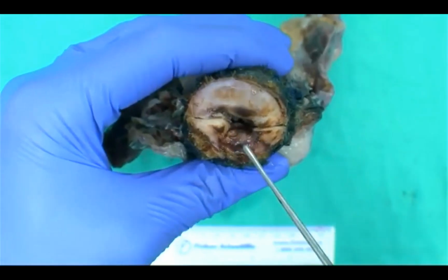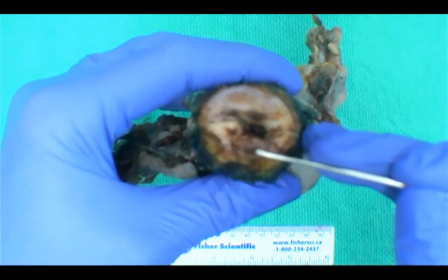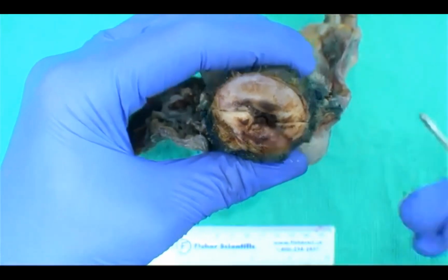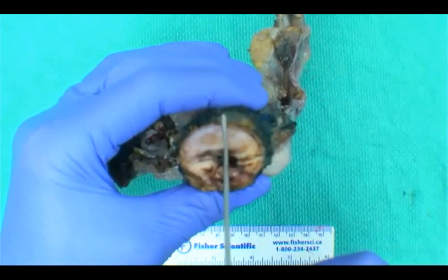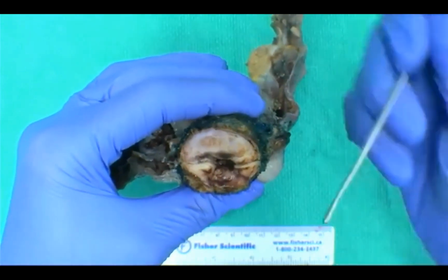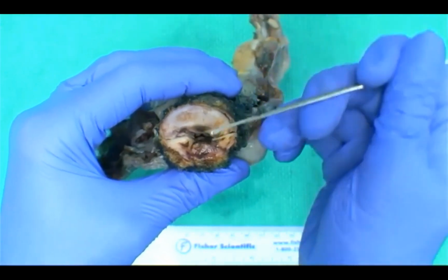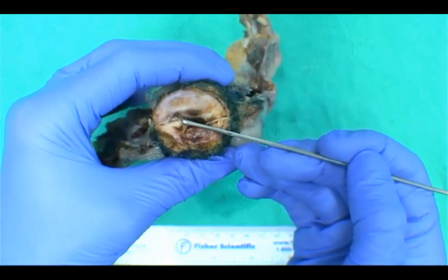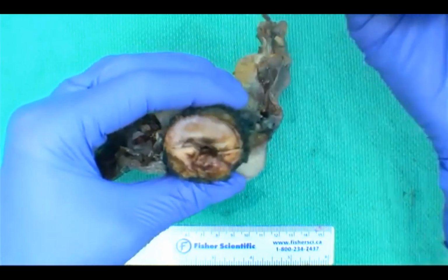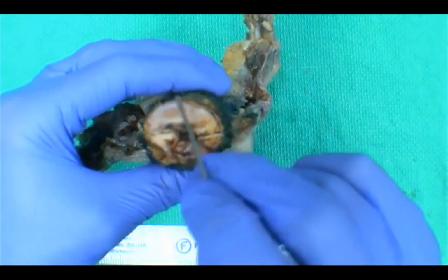and do a clock face. We would describe this kind of ragged and congested area as our lesion, and then you would want to give measurements to your vaginal cuff margin, which is right here. For us, we will designate the most anterior point as 12 o'clock and then radially section each quadrant. By radially section, we mean that we wedge the cervix. We'll section the cervix like so. And we usually end up submitting clockwise, and we'll designate 4 quadrants. So we'll submit from 12 o'clock to 3 o'clock, 3 to 6, 6 to 9, and 9 to 12 again.